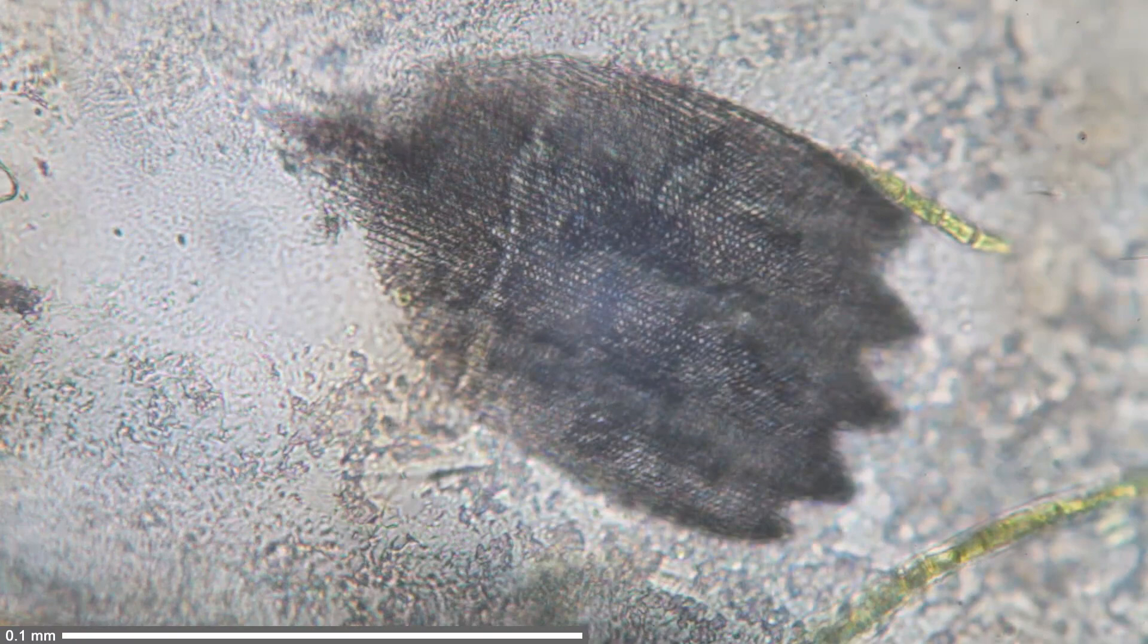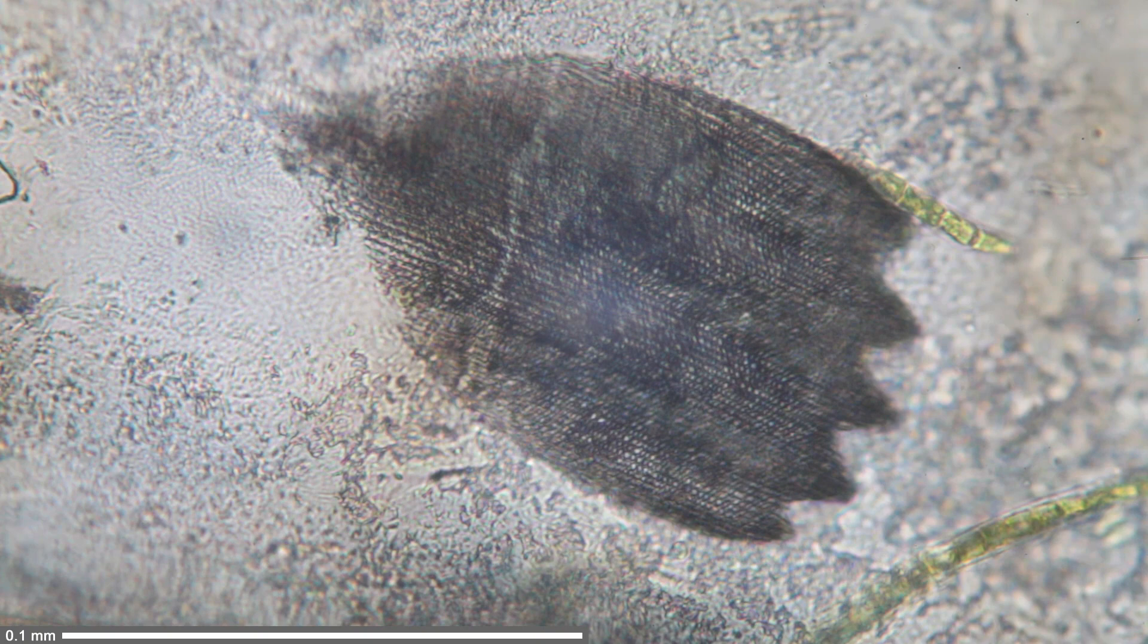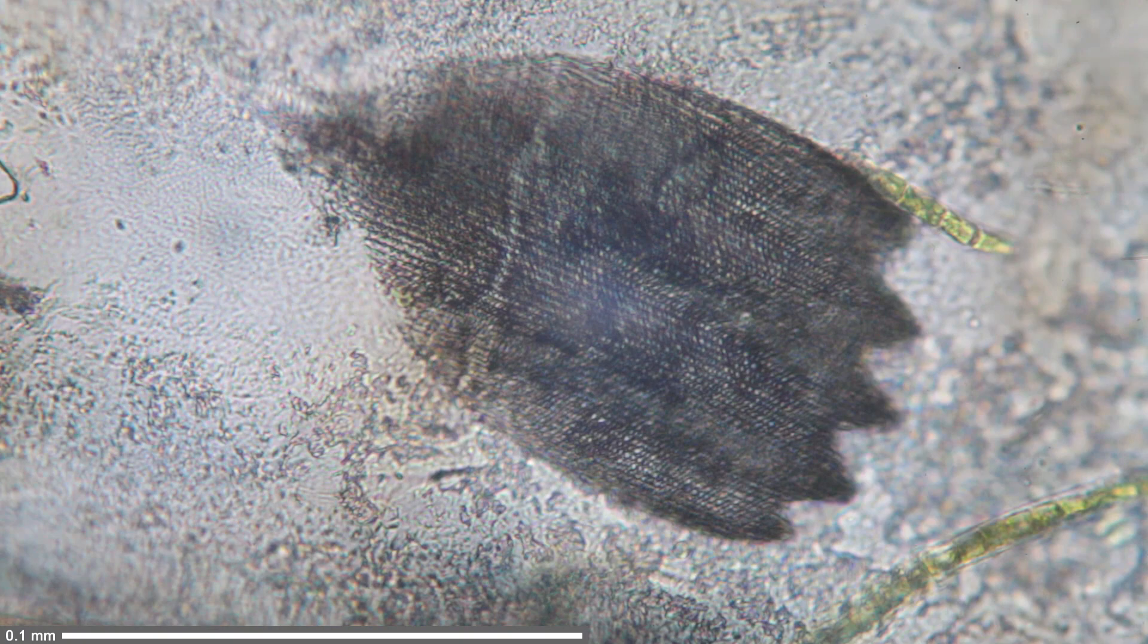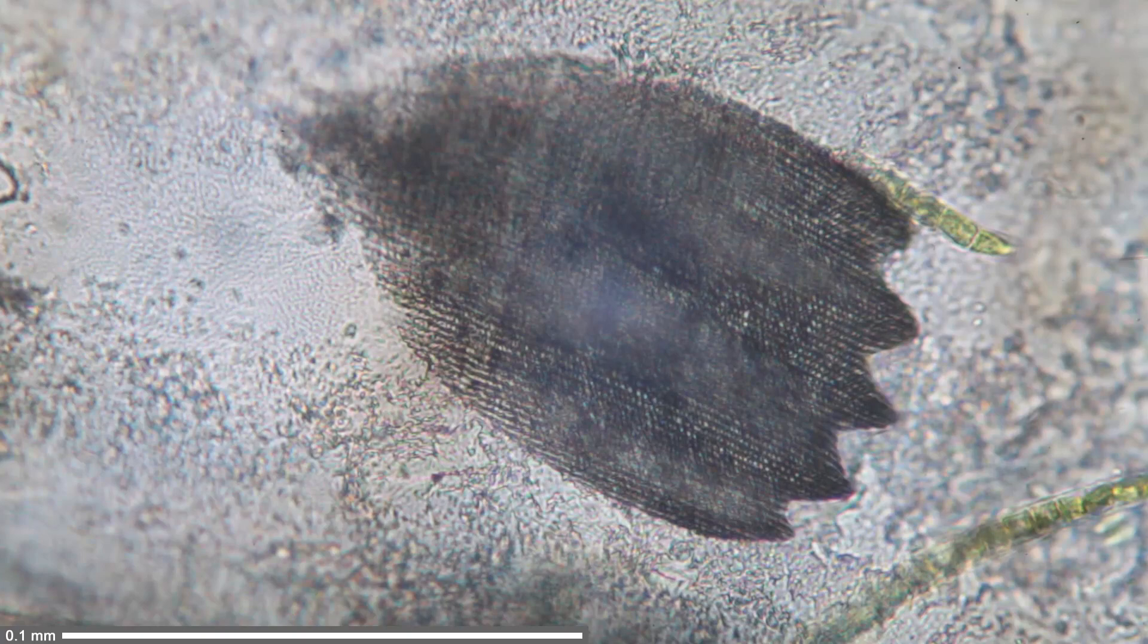This is still in bright field, using water, just regular microscopy, no special techniques here. You can see it's quite well visible. But what I'm going to do now is switch over to dark field. So I'm closing the condenser a little bit. You see the contrast is higher. I'm now going to switch over to dark field.